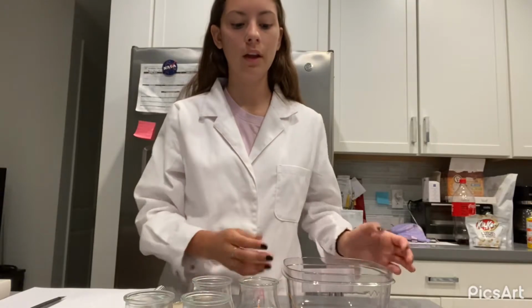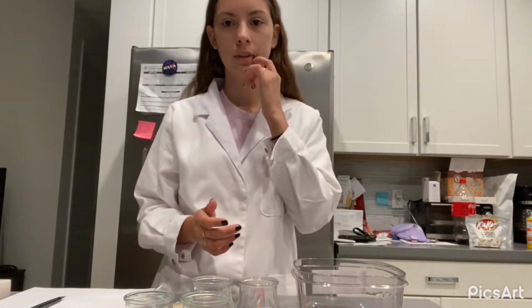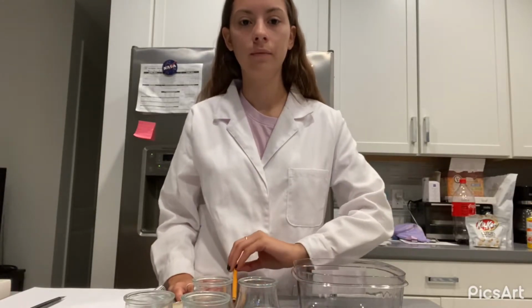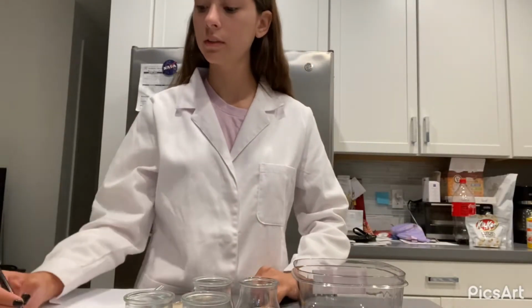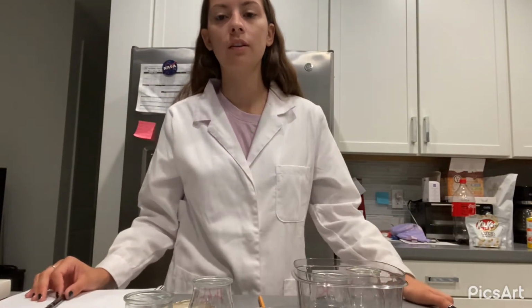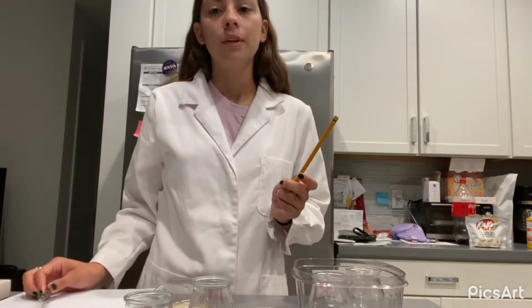Now we're gonna prepare a warm water bath using a 250 milliliter beaker. We want our warm water bath to be at a 60 Celsius temperature, so let's see if that's correct. And now we're gonna record it. And we're gonna place our high temperature test tubes with the different solutions in it for at least 5 minutes. We also want to record our room temperature, and right now, using our thermometer, it is 22 Celsius.